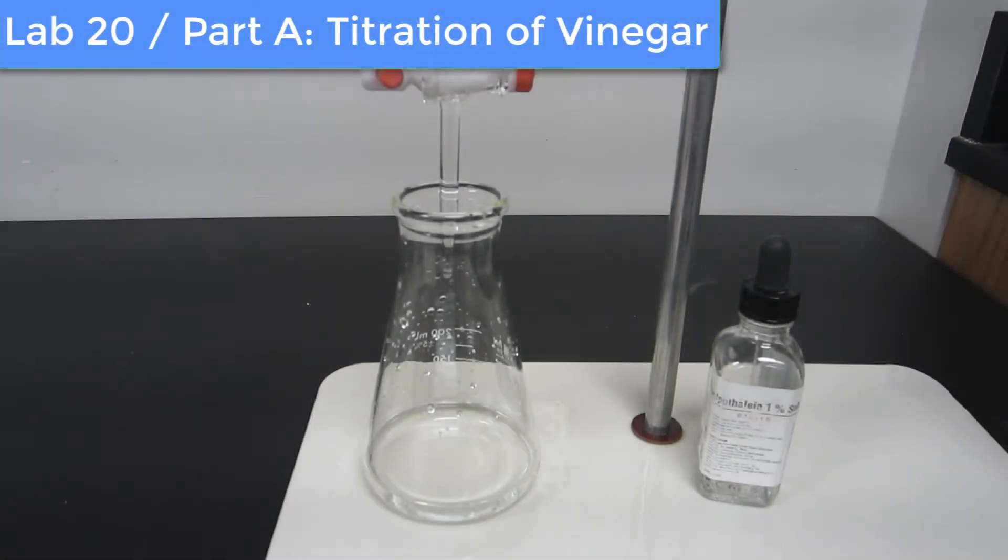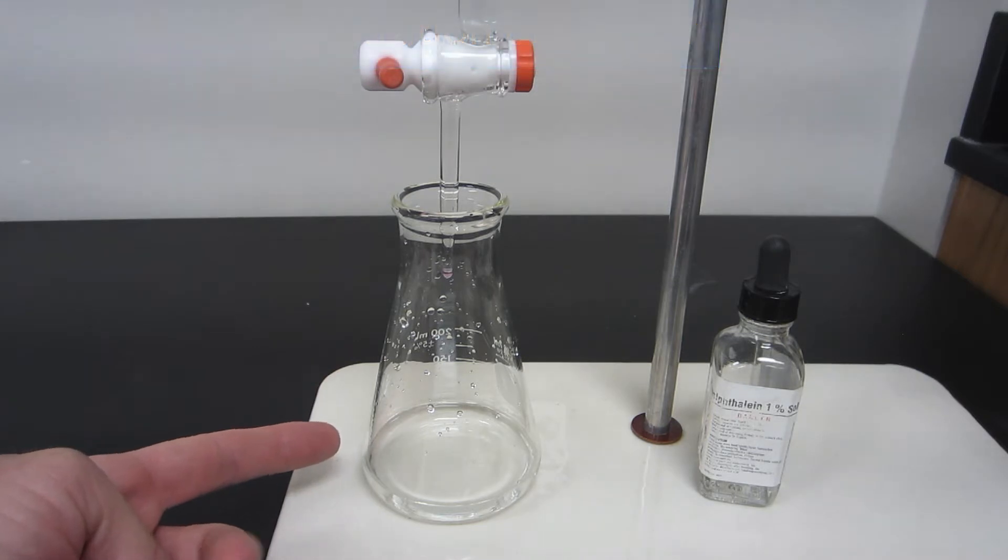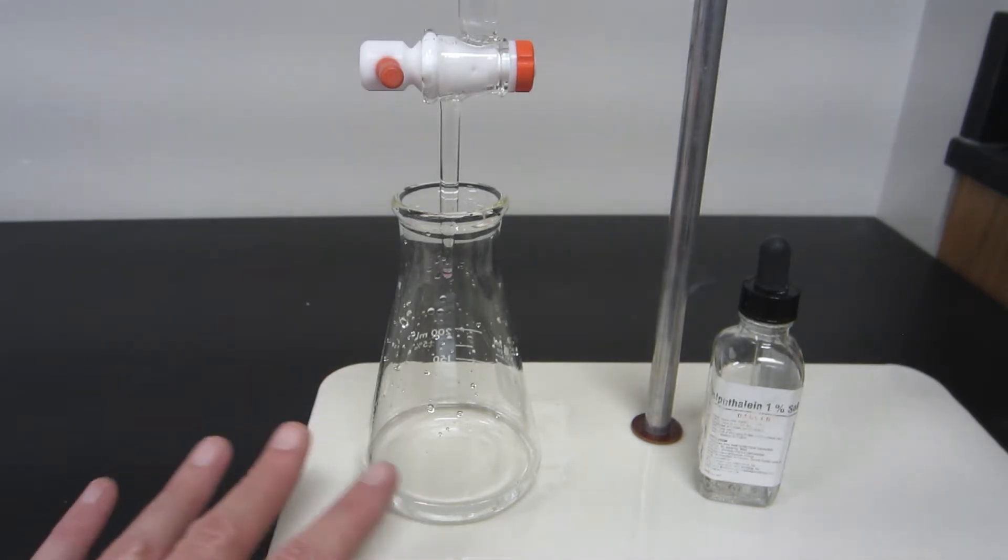So what we have in front of us, I put the vinegar solution in here along with about 25 milliliters of water, distilled water, and that water is primarily there just so you can really see the color change more easily.